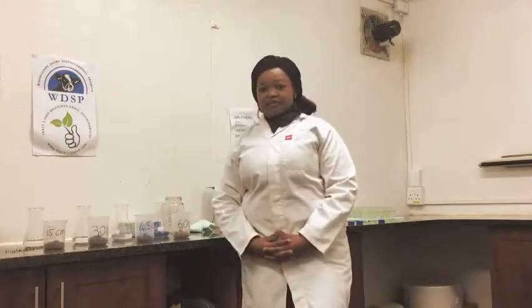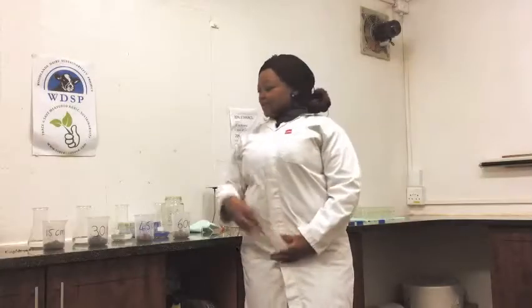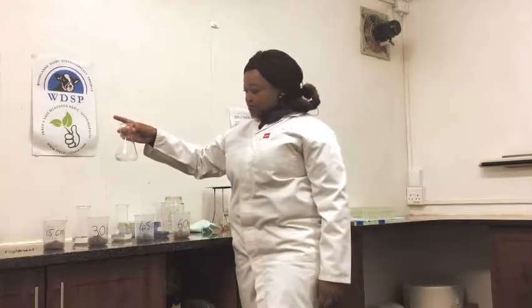This sample, as you see here in front of you, has been taken at four different depths: 15 cm, 30 cm, 45 cm, and 60 cm. In this experiment I'm going to be using hydrogen peroxide to find out how much carbon there is in each sample. I will be pouring 100 ml of hydrogen peroxide on each sample of soil.